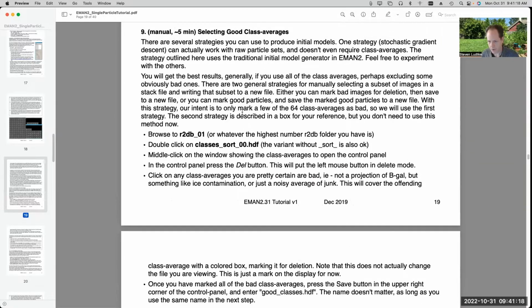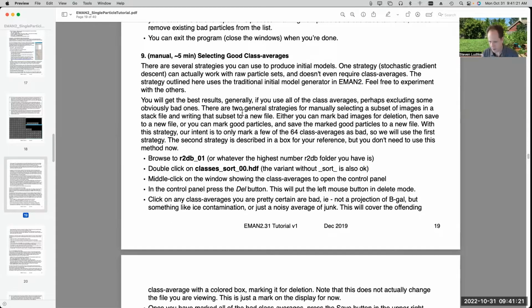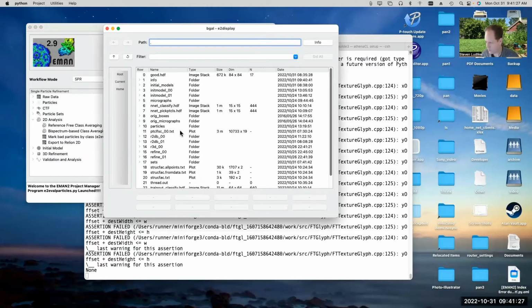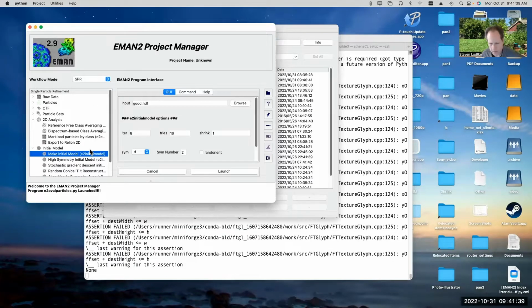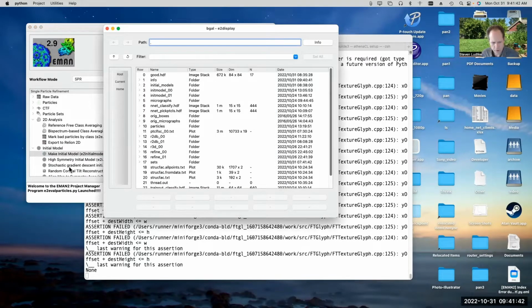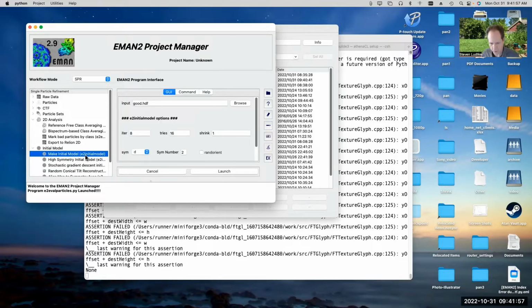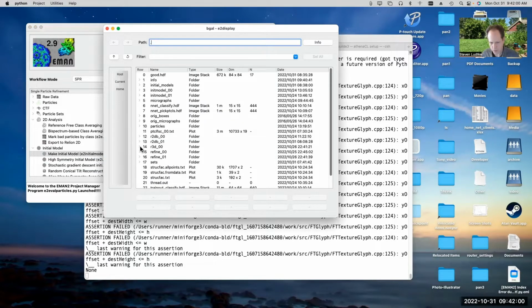Now, there are a couple of different strategies you can use to make an initial model. One strategy is you can look at your 2D class averages, and pick a handful of good class averages from the set of 2D class averages, and then use those with the old style initial model generation program, Make Initial Model. Or there's a new program here called Stochastic Gradient Descent Initial Model Generation, which doesn't actually require class averaging at all. And in fact, it will often run better if you give it raw particles than it will if you give it class averages.